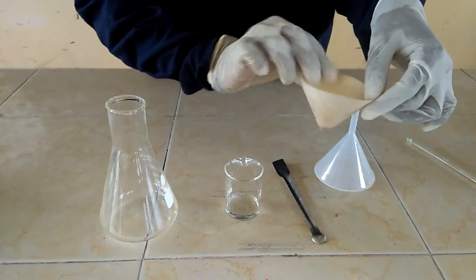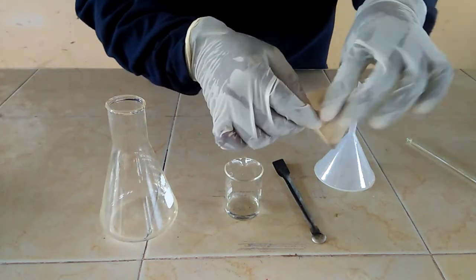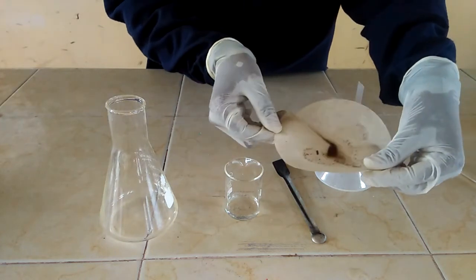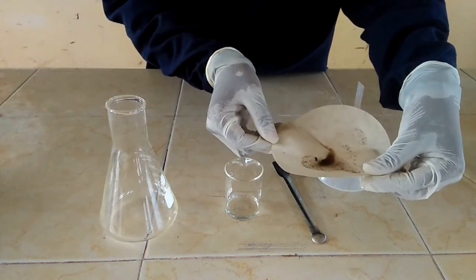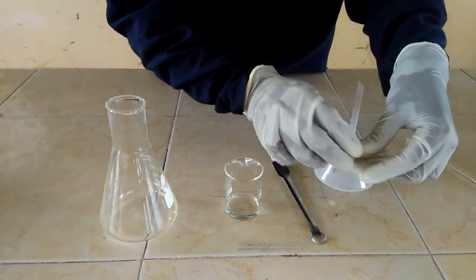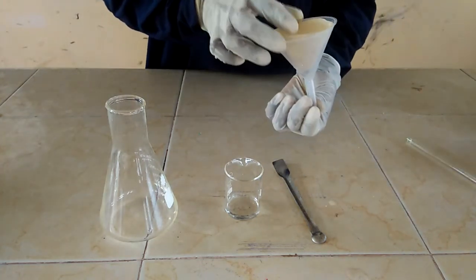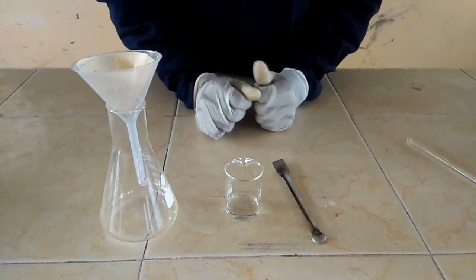And then on the filter paper we have the solid that has remained. So the solid is our residue. We have been able to separate the mixture of soil and water.